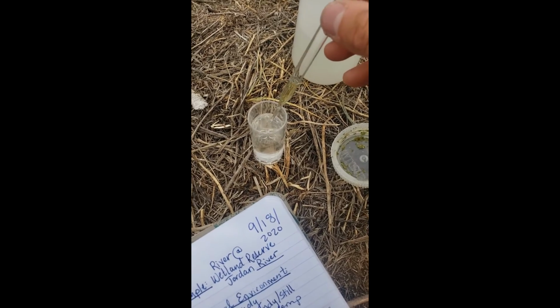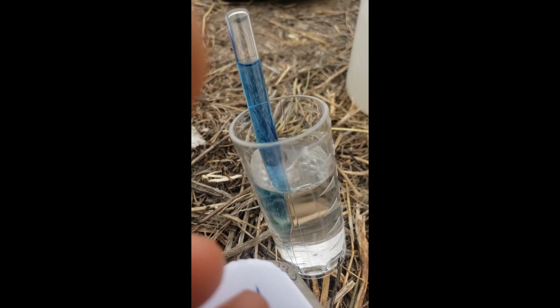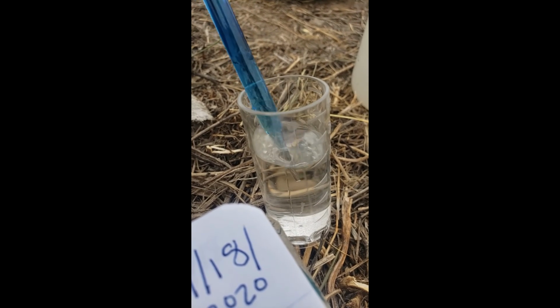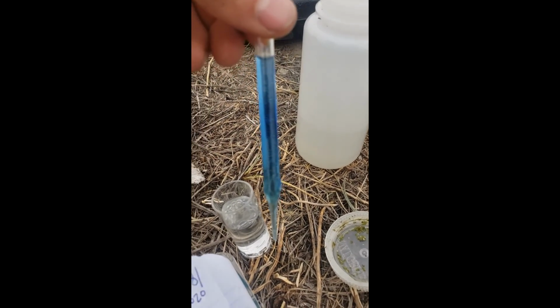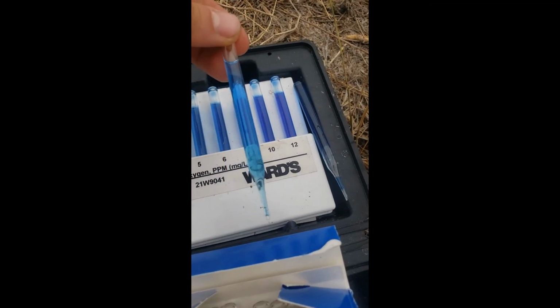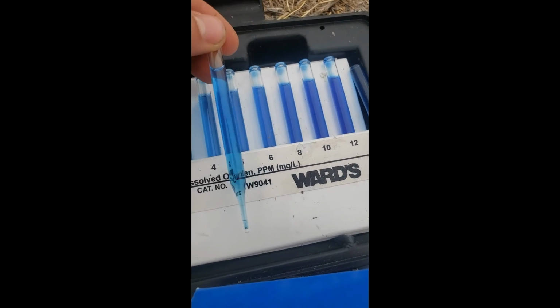All right, so here we go measuring our dissolved oxygen. Go ahead and put this in and take a close look at how fun this reaction is. And what we'll be able to see here now is how much dissolved oxygen is in the water. It's a little bit tricky sometimes because of how oxygen saturated our environment is. The water becomes saturated. So it's important to try not to disturb your water sample when you grab it, and let any solids sink to the bottom, so that's not affecting it either. But then we can go ahead and measure up against our water samples here. So I think we're pretty high in oxygen.